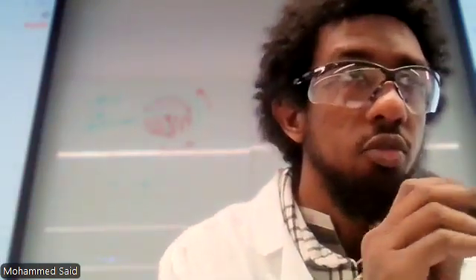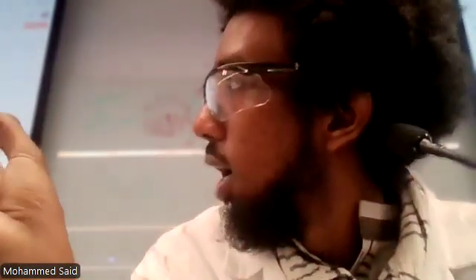Anyone having questions so far? Any difficulty? Also, just to confirm, is everyone done making their plates for conjugation? Who's not done with conjugation for their first two plates? Raise your hand. Group 4, you're done, right? Group 5, is your group done with the two plates for swabbing? Same for your group. And all three of you, I believe, as well. You're fine.